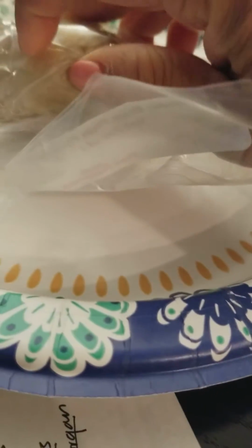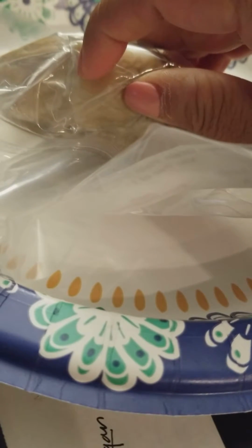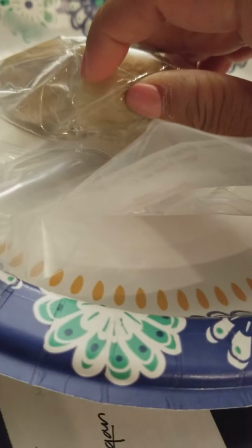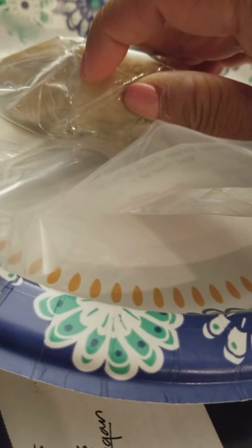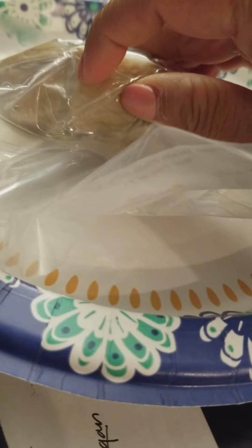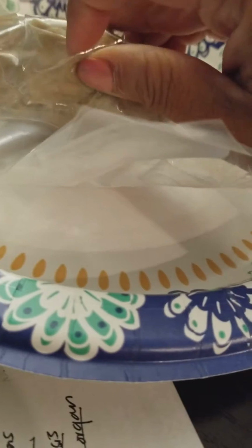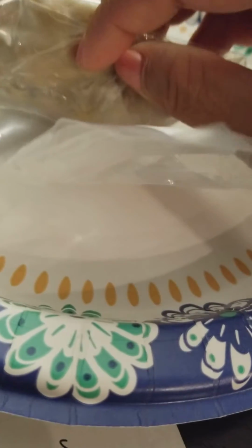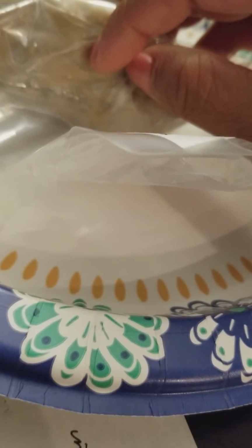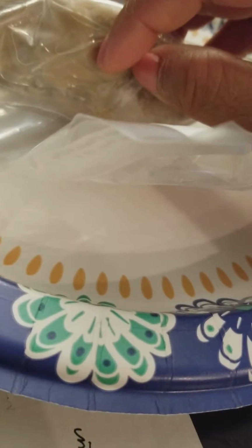So just around this area, we'll have the septum pellucidum, which is the membrane that separates the lateral ventricles, and then more inward of it, maybe around that area, would be the corpus callosum, which connects the left and right hemispheres.